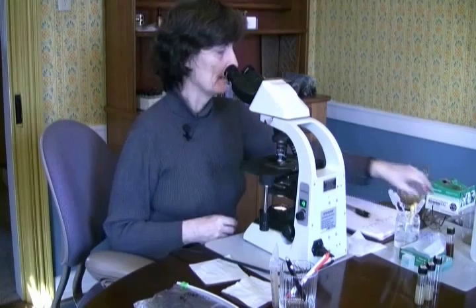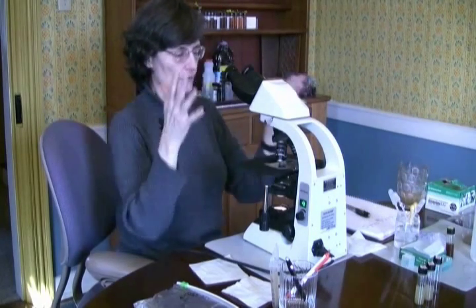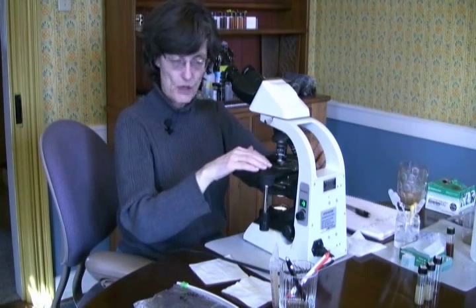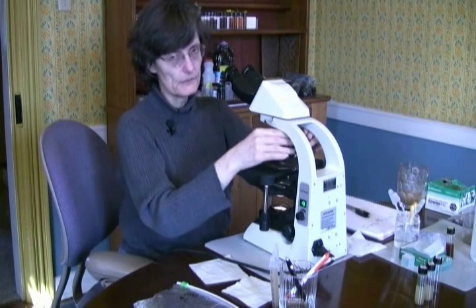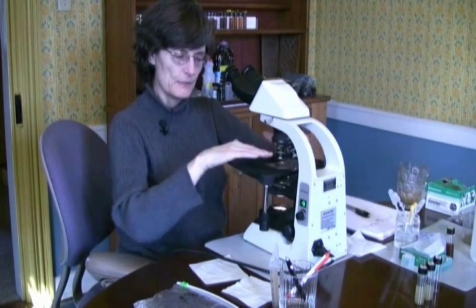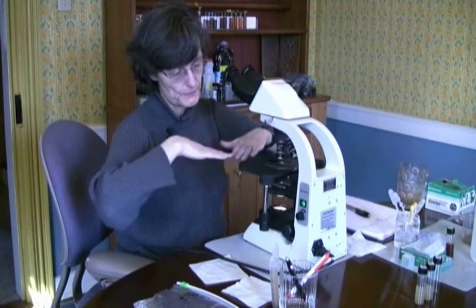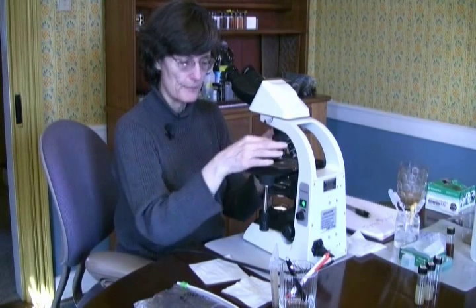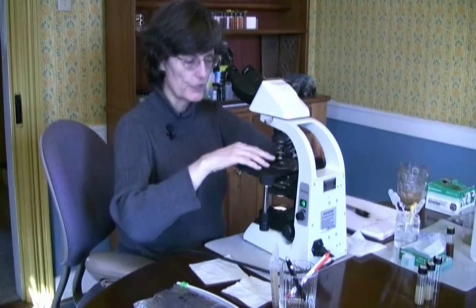We've gone through and done an assessment, giving you a quick overview of how to look at this and how fast you should be going through all of this. Now I'm going to take my sample off the slide. If you're worried your hands aren't real steady and you might scrape against your objective as you pull that slide off, just dial in the 4X lens so you've got plenty of working space.